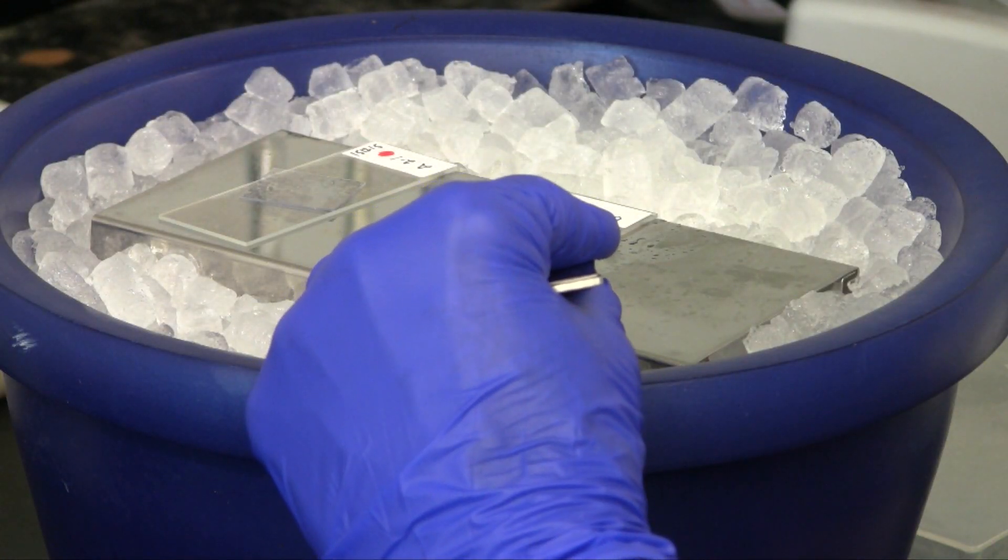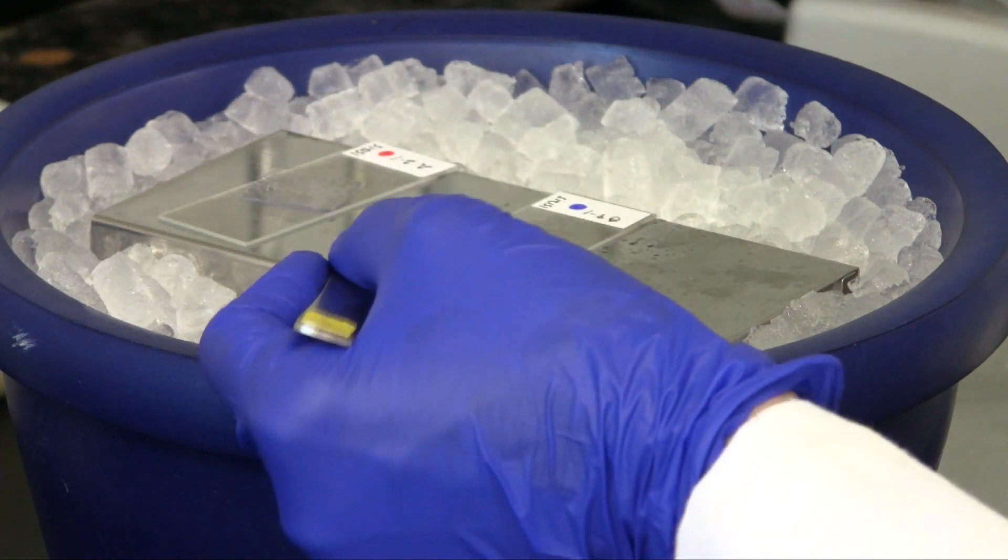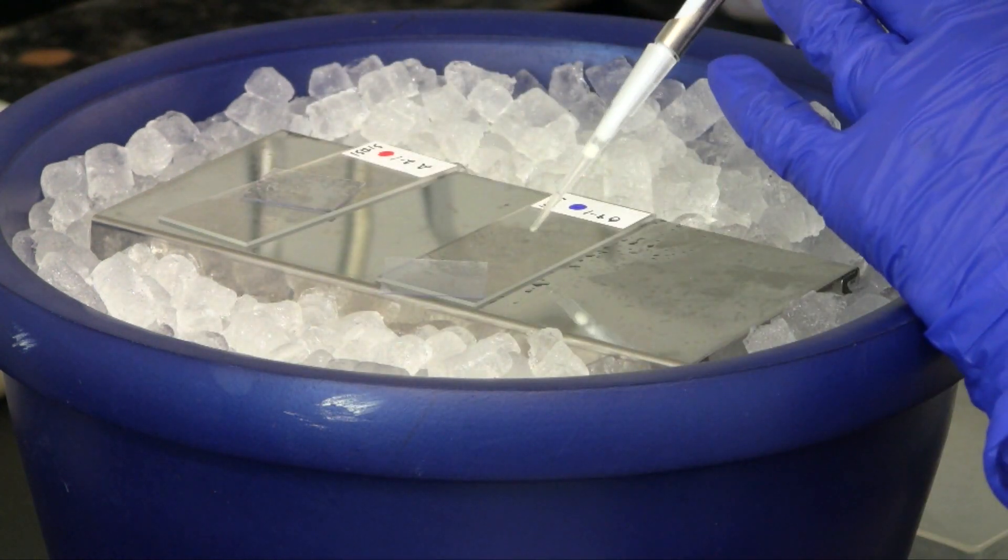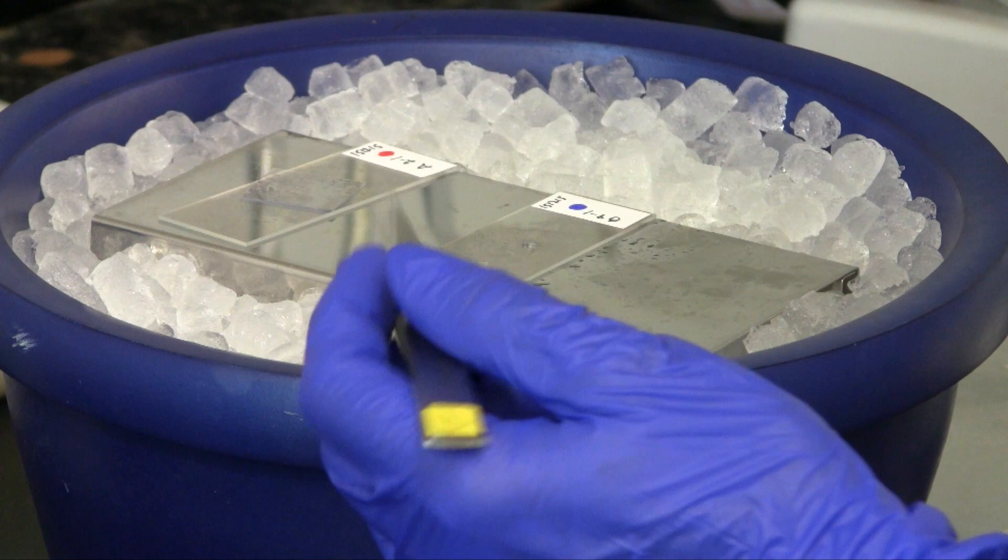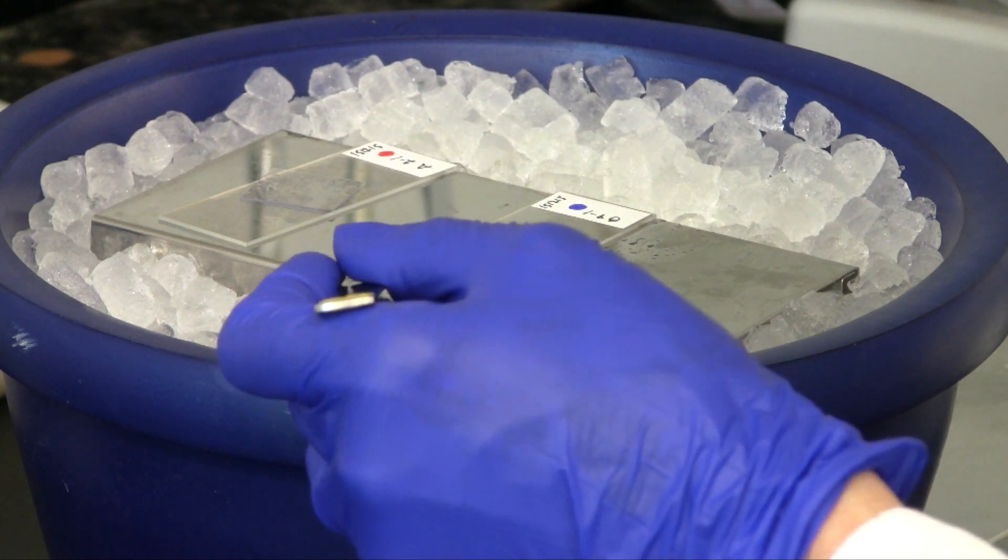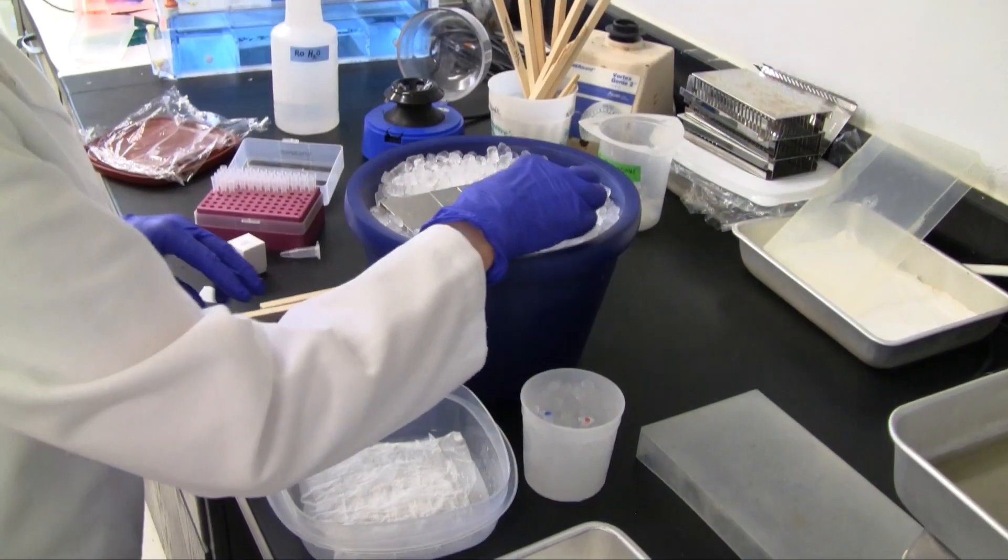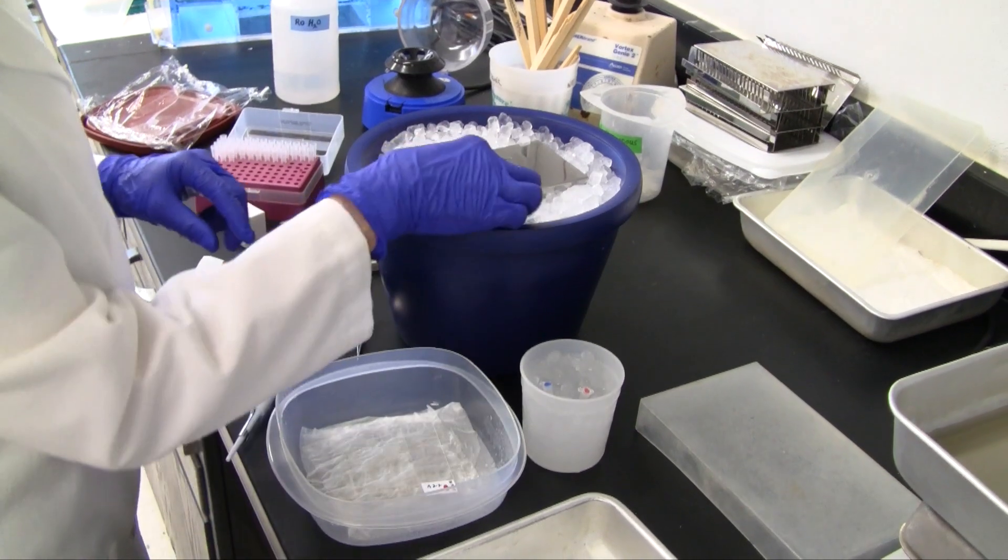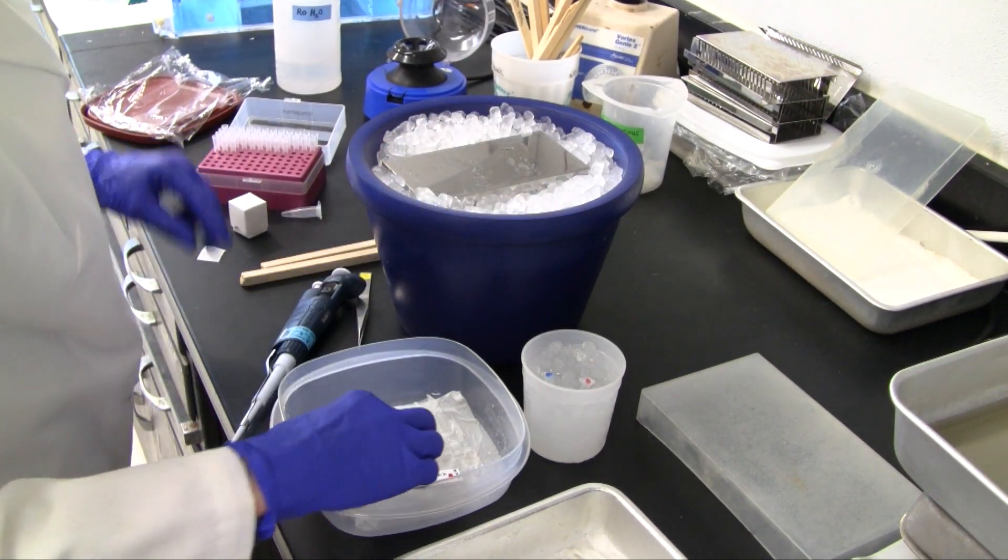Alternatively, the cover slip can be removed, flipped over, and set aside. After the probe is applied, the cover slip is replaced. As in the large target method, the slides are transferred to a moist chamber for hybridization.